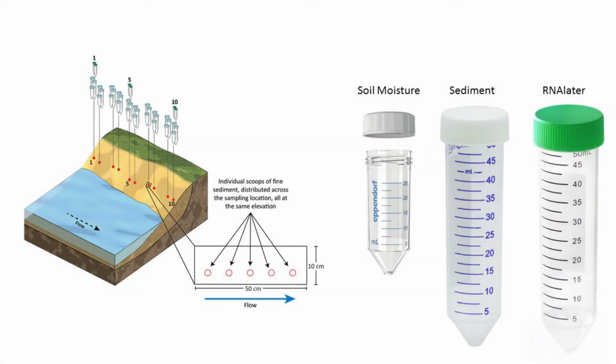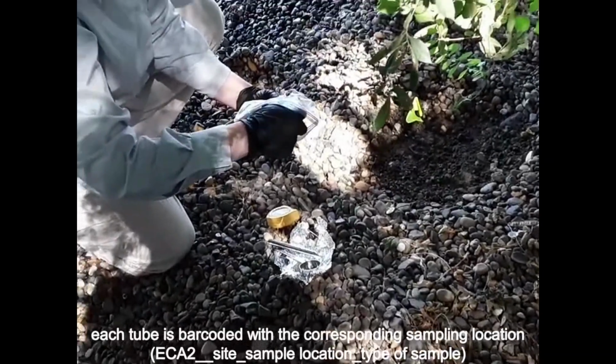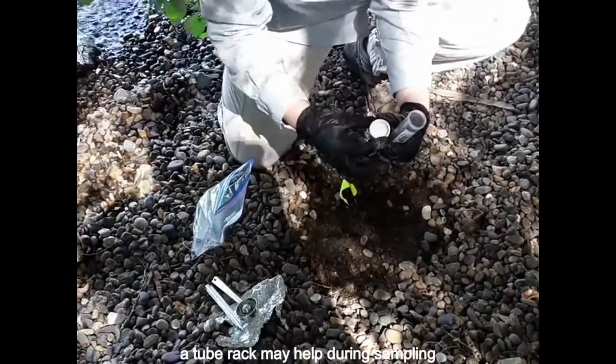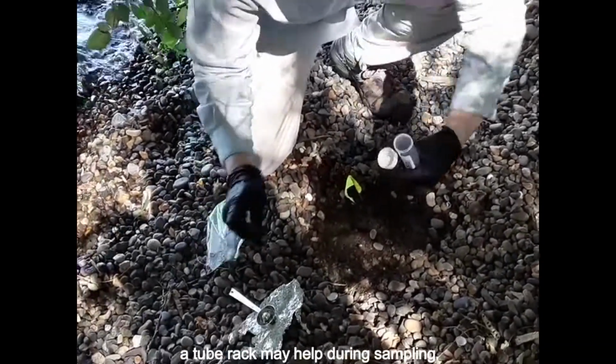There are 2 components to the sediment sampling. At all 10 locations, undisturbed sediment will be collected to fill 2 empty 50 milliliter tubes and 1 25 milliliter tube. In addition, at the most upstream, most downstream, and the midpoint location, 2 additional green cap tubes will be used to collect sediment into RNA later to preserve microbial communities. It is vital to ensure the right sample number is used for each location. When you receive the kit, the tubes should be bundled by location, but please verify each label before use.